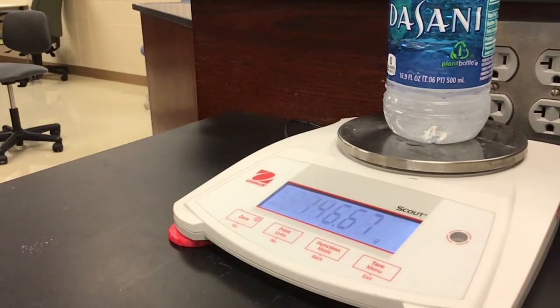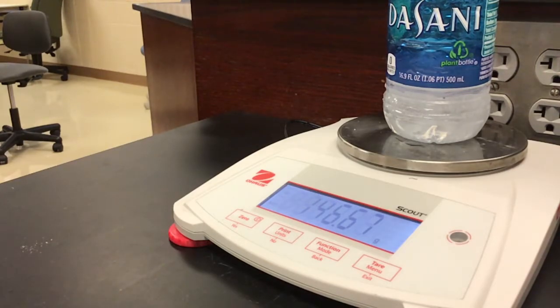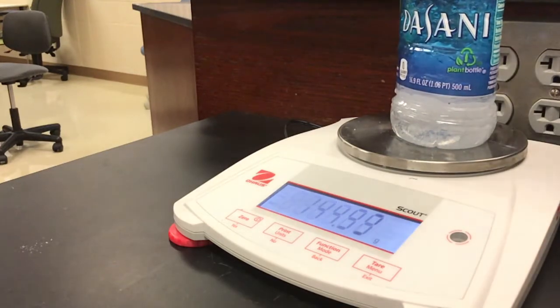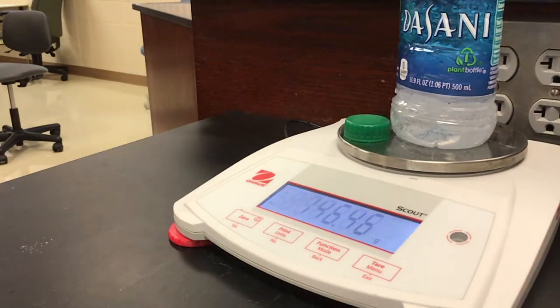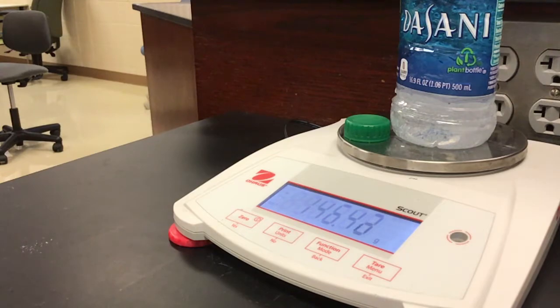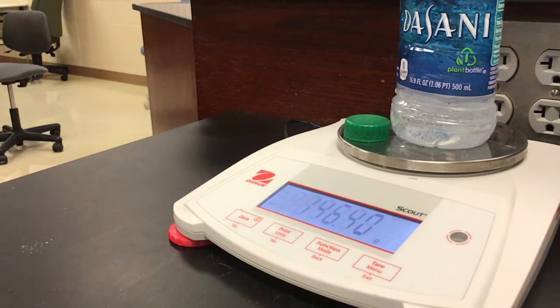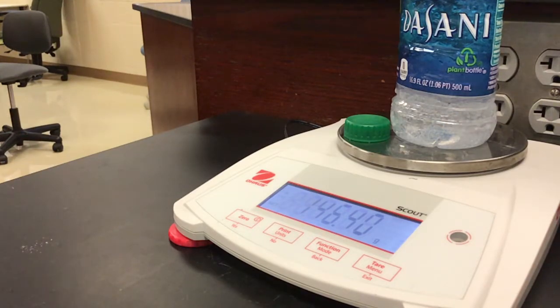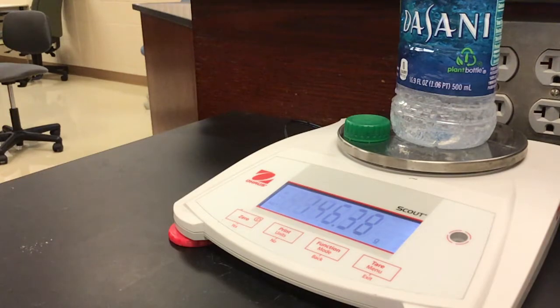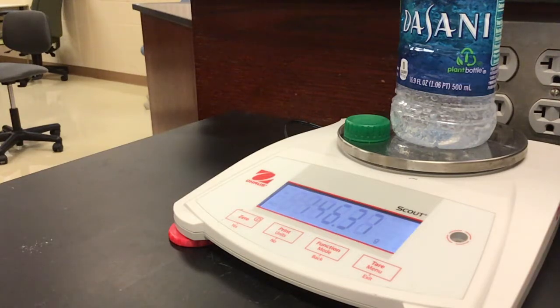We're going to wait until it's fully dissolved. It's the mass after one minute — the mass has changed maybe a little bit. I'm going to open it. Let's look at the mass now — it says 146.43. Looks like it's going down a little bit more. From that you should be able to get all of your information from the lab as the mass continues to drop.